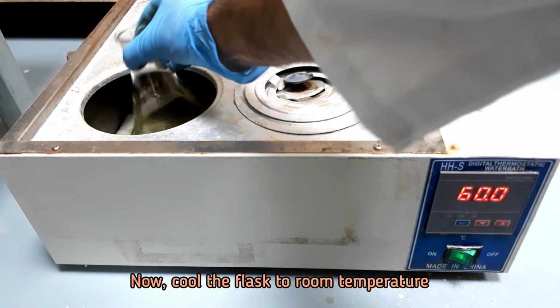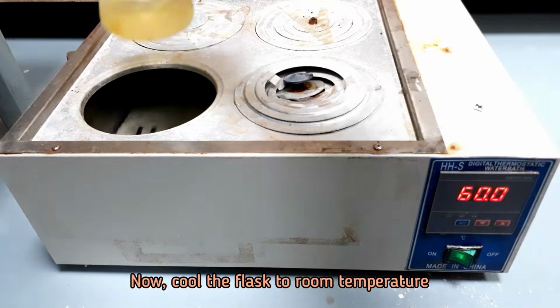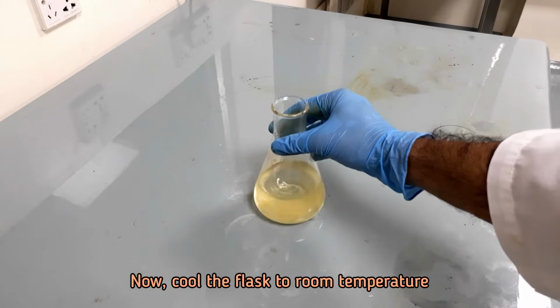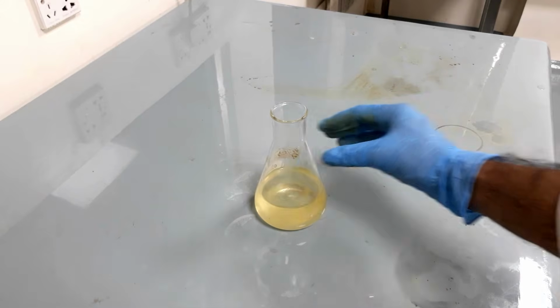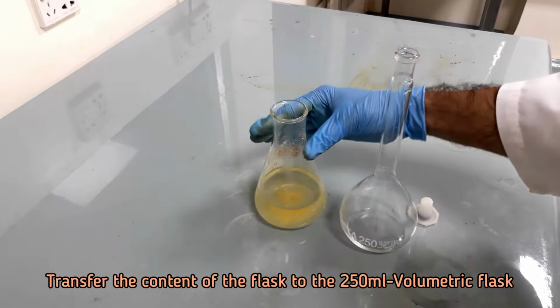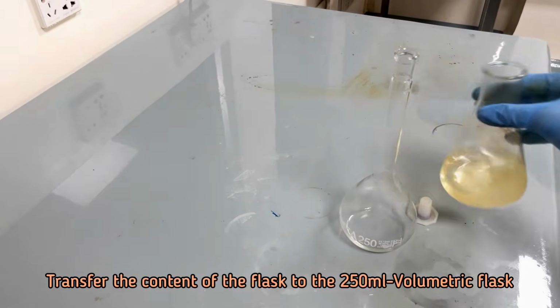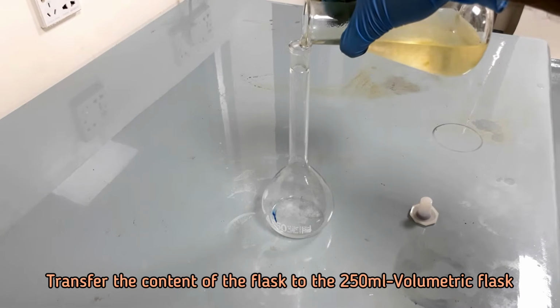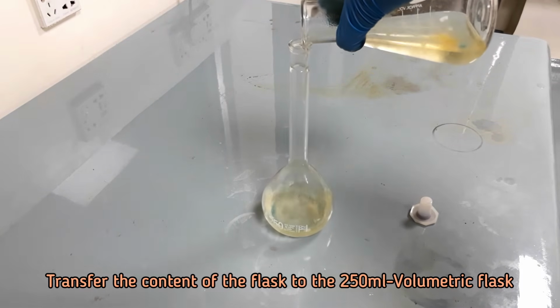After 30 minutes, cool the flask to room temperature. Transfer the content of the flask to the 250 ml volumetric flask and dilute to final volume of 250 ml.